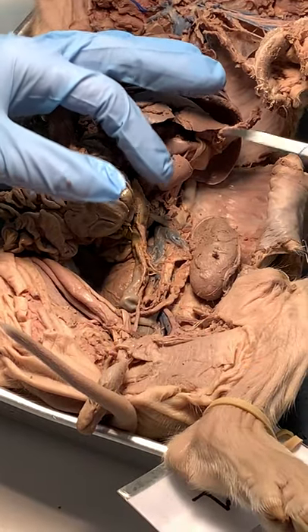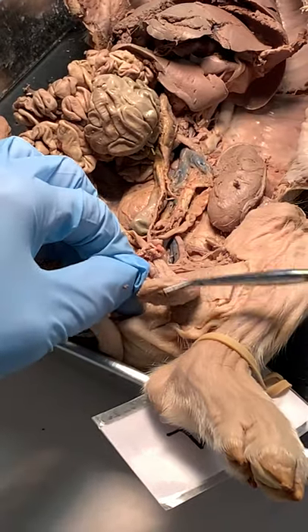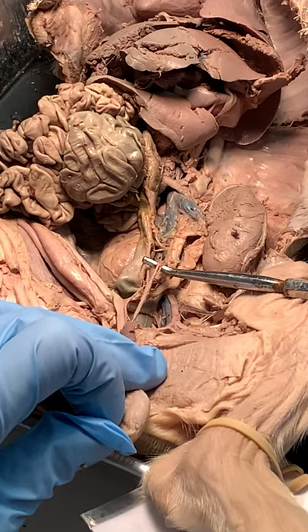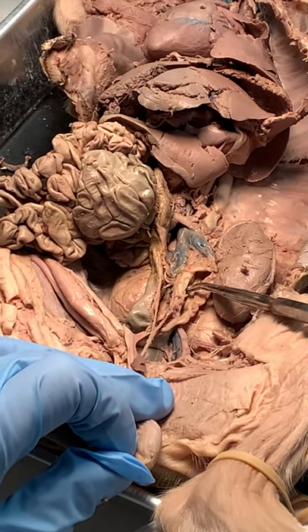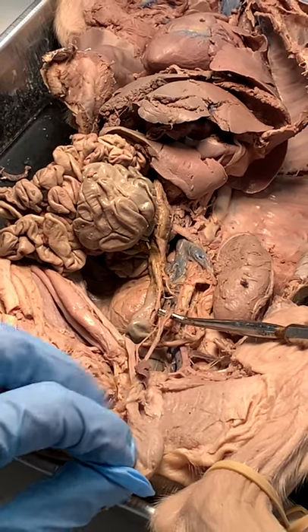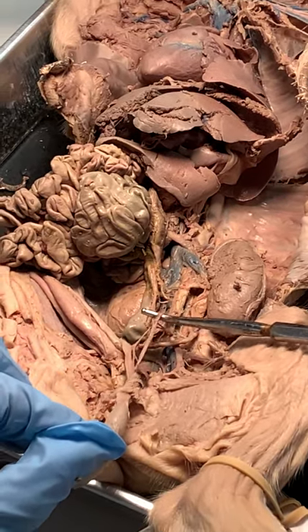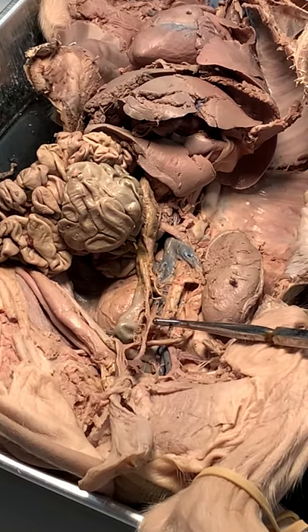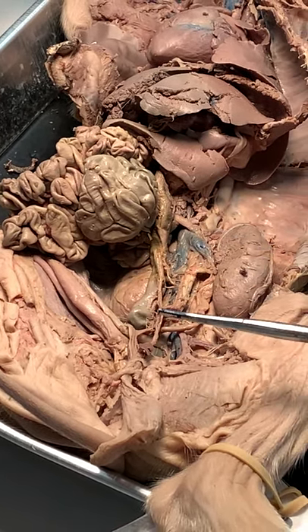We want to look at the gonadal artery. Here's a testis — there's the left testicle, still in the sheath. I can see this little red thing right there, and if I pull up, the aorta comes with it. This is the aorta; this is a ureter. If I pull this up, you can see that it moves the testicle and the aorta — so that's the gonadal or the testicular artery. If it were an ovary, it would be going to that and I would pull the uterine tubes and the ovary up with it.